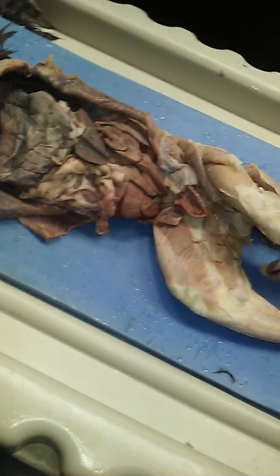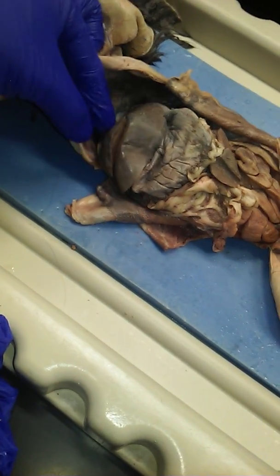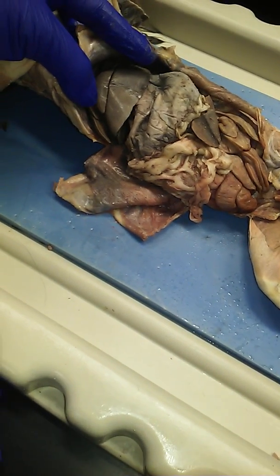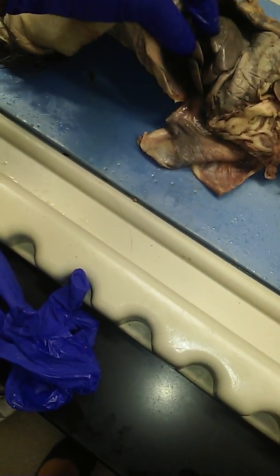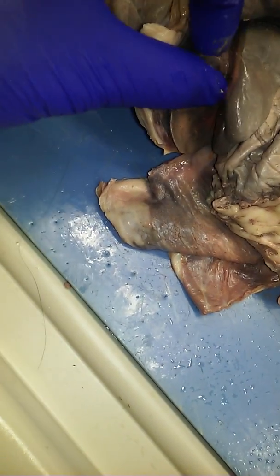There are some deep valleys in it, dividing it into pieces. Those chunks of an organ are always called lobes. So the cat's liver here, typically right up front where you can see it, has 4 lobes. L-O-B-E-S. The liver is divided into 4 chunks. Yes or no? Yes. 1, 2, 3, 4.